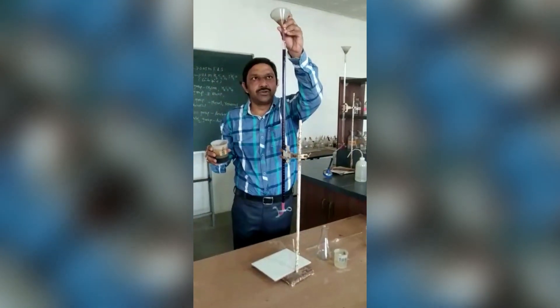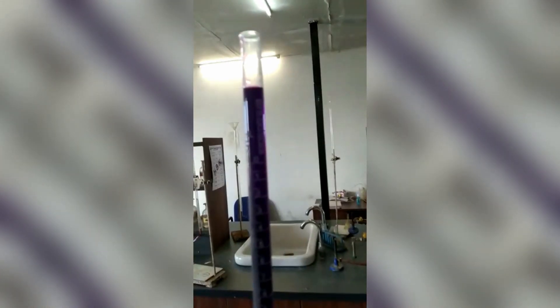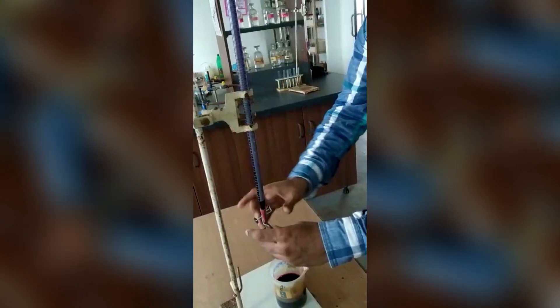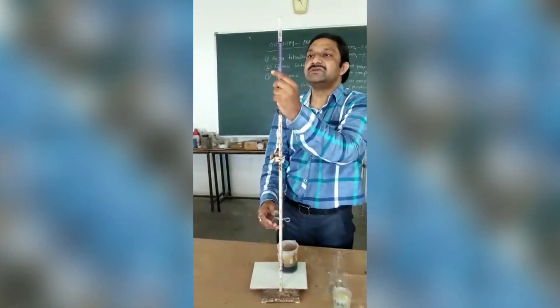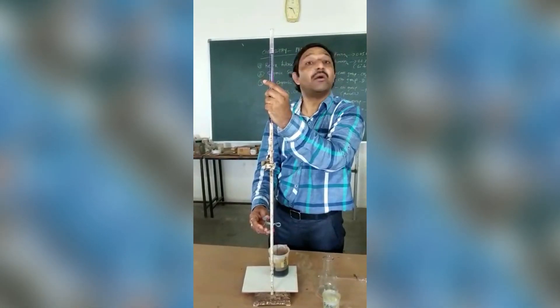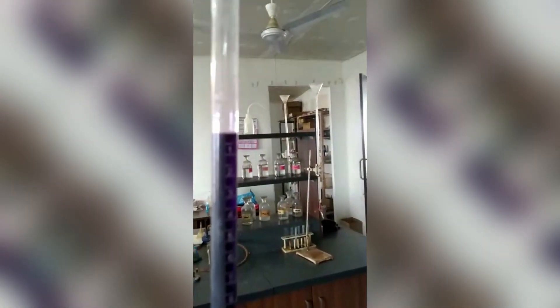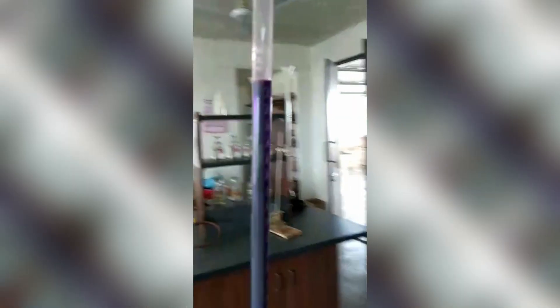I told you, you have to set the upper meniscus. Here is your upper meniscus — set your jet here. Zero meniscus, but upper meniscus, not lower meniscus. Here is your upper meniscus for KMnO4 solution — you have to set the upper meniscus. Clear?